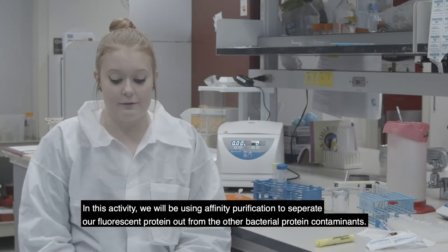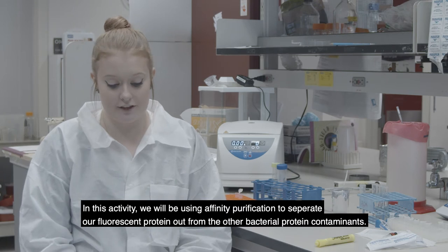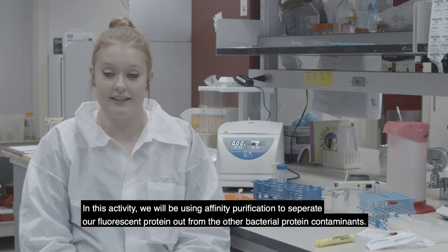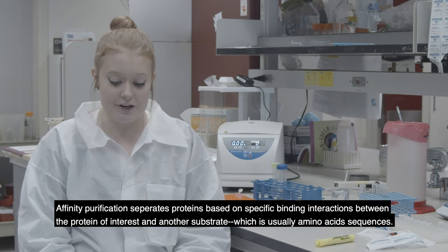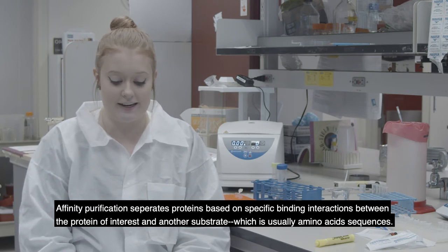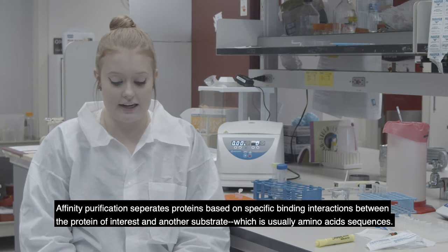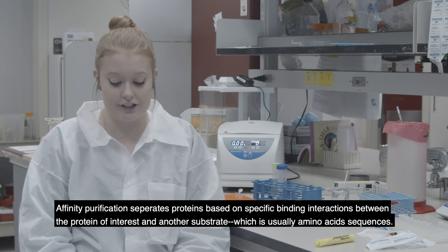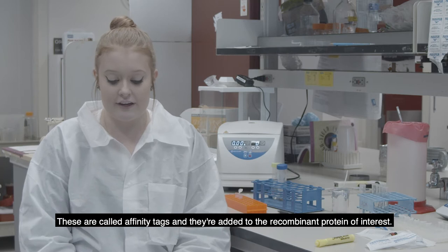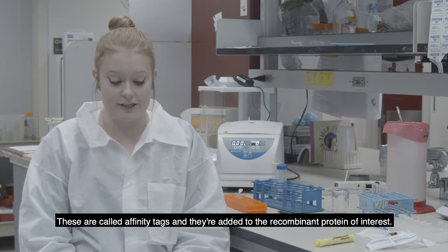In this activity, we will be using affinity purification to separate our fluorescent protein out from the other bacterial protein contaminants. Affinity purification separates proteins based on specific binding interactions between the protein of interest and another substrate, which is usually amino acid sequences. These are called affinity tags, and they're added to the recombinant protein of interest.